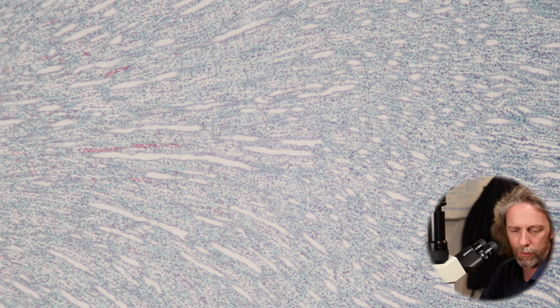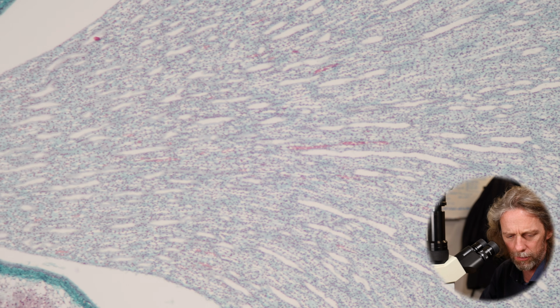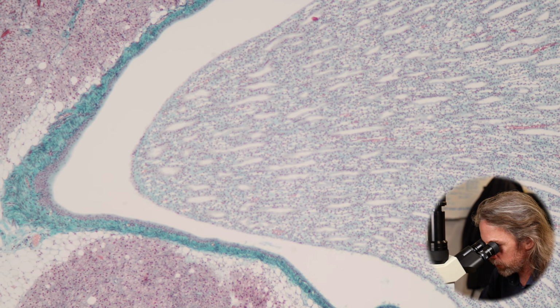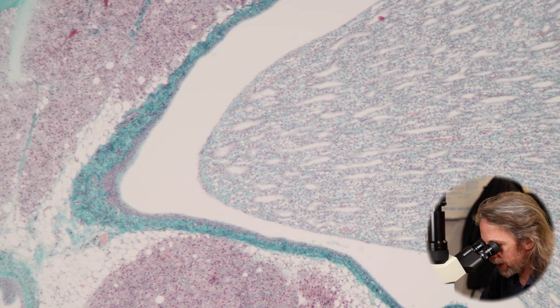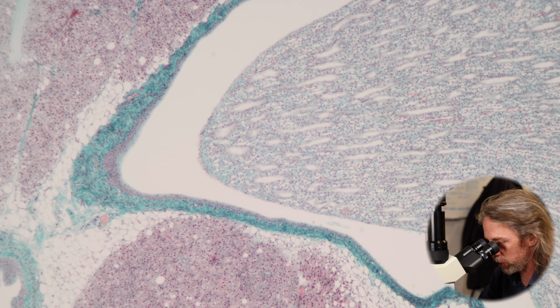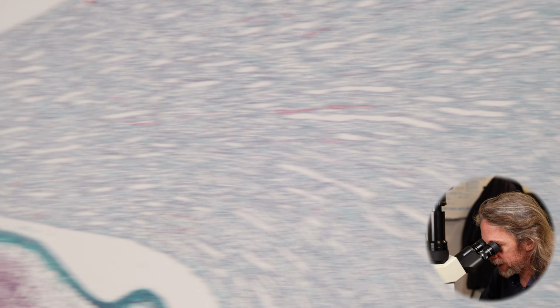Oh wow, that's great. I'm seeing the shape of the pyramid. There we go. As it comes into frame view. So there's the tip of the pyramid, of the renal pyramid, and all those collecting ducts and papillary ducts are draining to that point, and then we have a space there in the kidney, and that space is the minor calyx. That's where the urine is collecting. That's the overview. Let's go back to the top.